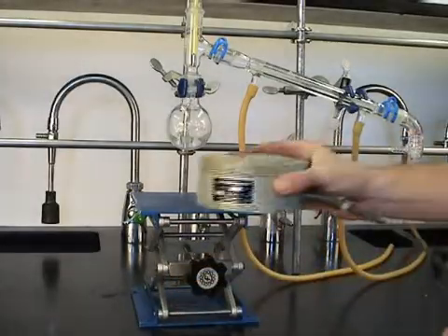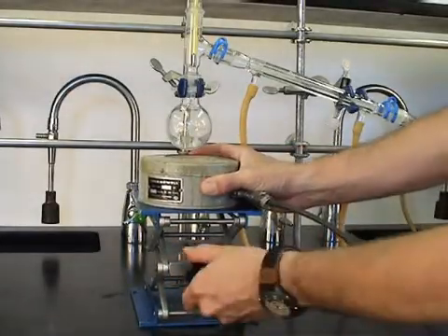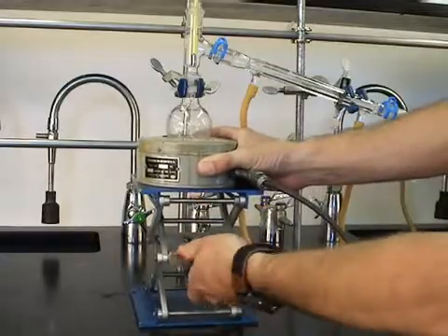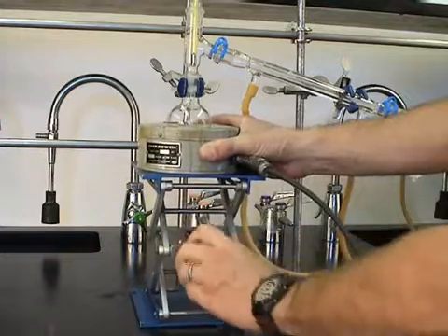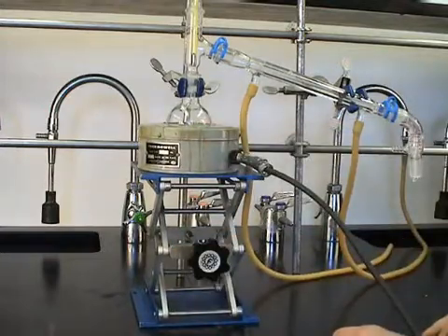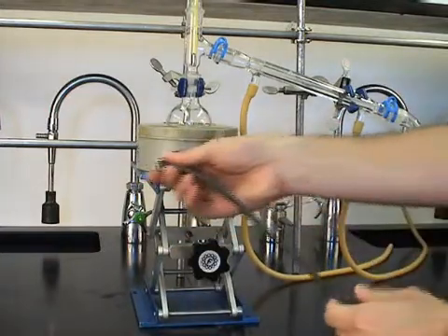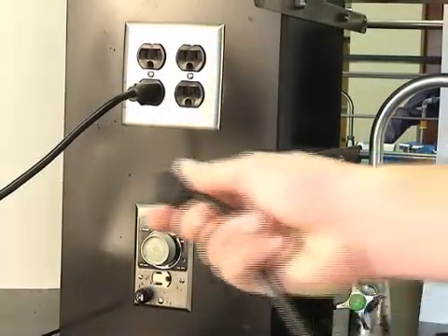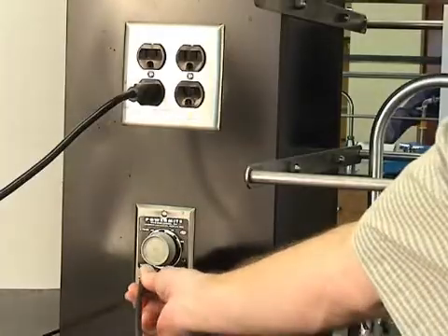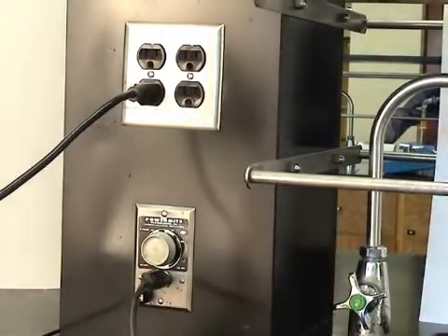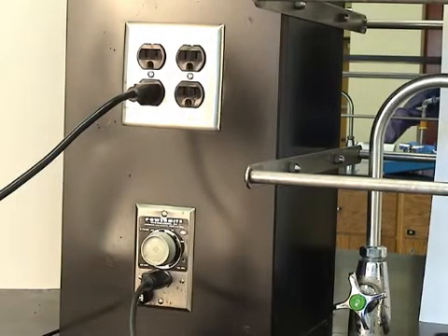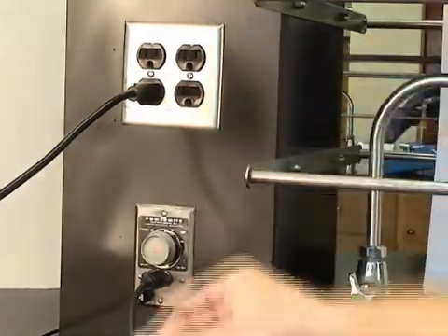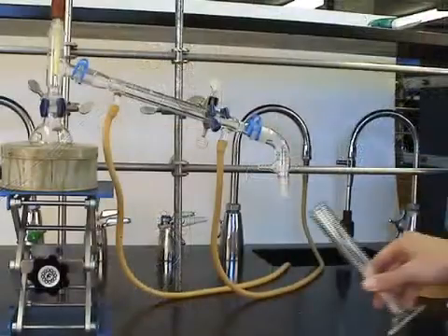We use a jack to support a thermal well. This allows us to adjust the heat quickly if need be by simply raising and lowering the jack. The thermal well is raised up so that it's in contact with the flask. And then connect it to the power mite at your lab station. Never ever connect it directly to the 120 volt plug.